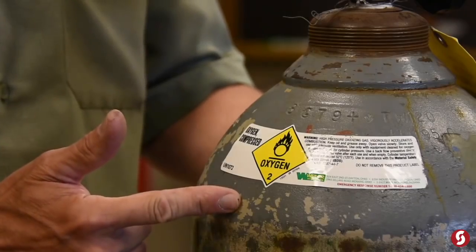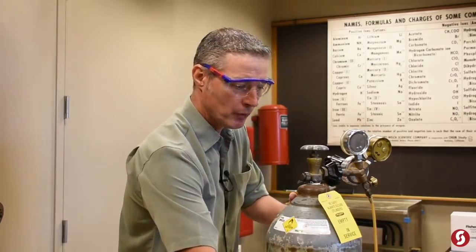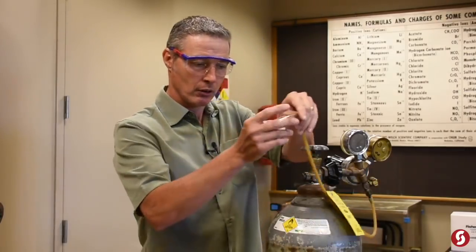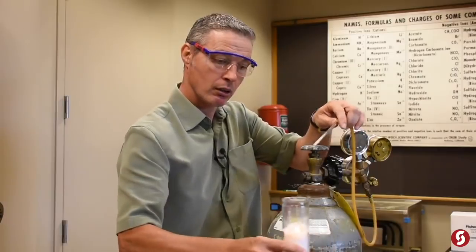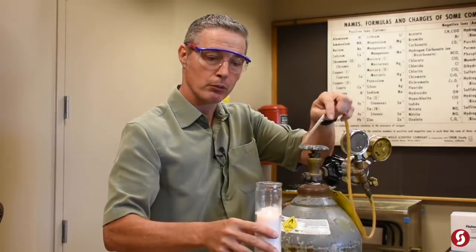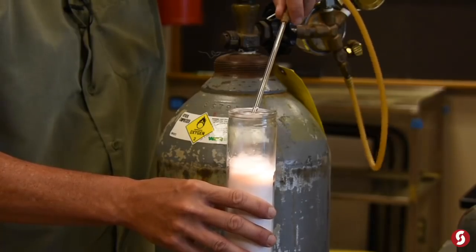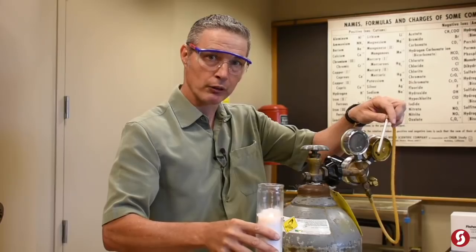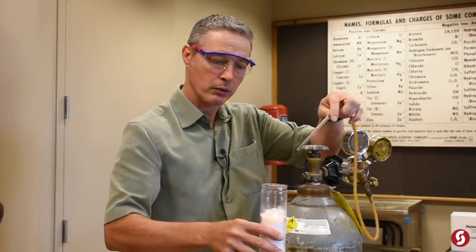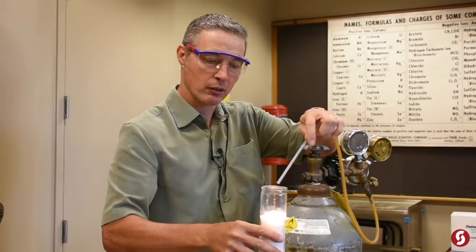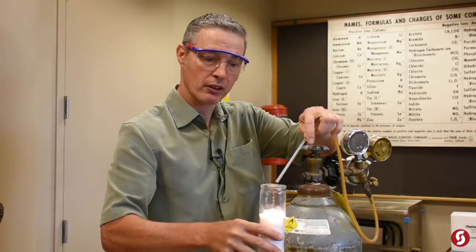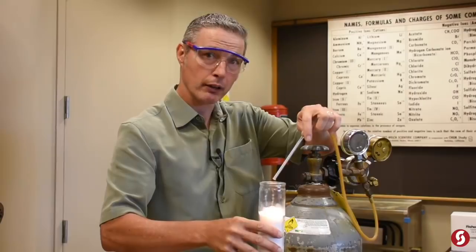Here's our friend, the oxygen tank, which has pure oxygen in it. And here's our candle. And just to demonstrate for you how much combustion is supported by oxygen, take and just start to breathe in. See that? Take it away. Burns just like it normally would. Breathe oxygen in there. Really, really burns a lot hotter and a lot cleaner.